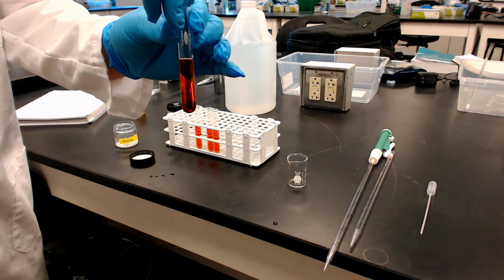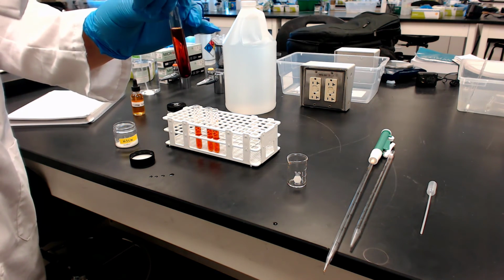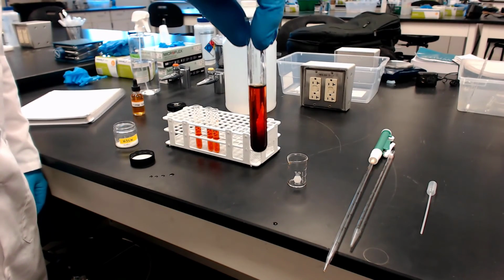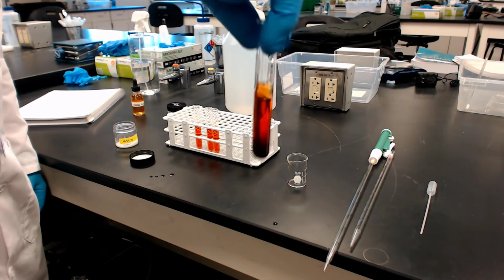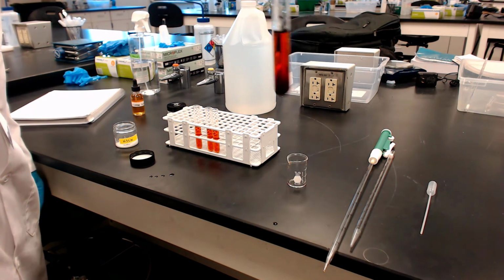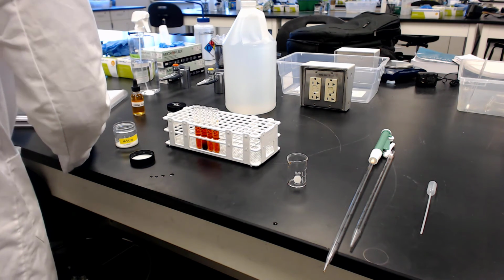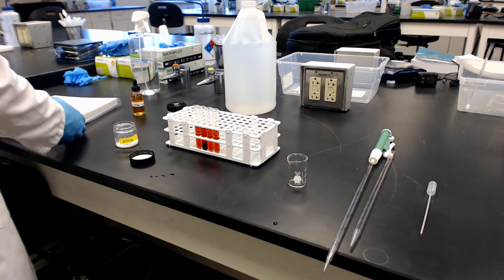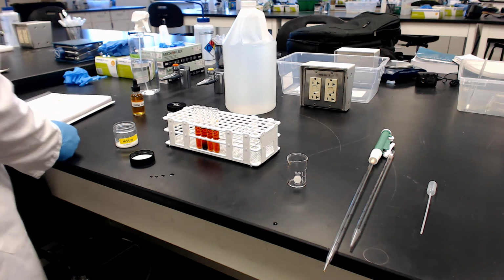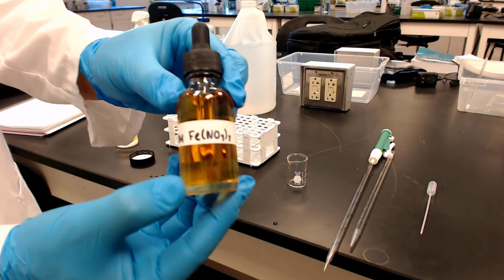So he adds that in there. It does a little swirling, and you can see it at the bottom. It's definitely driving the equilibrium. This is a good chance for him to use some technique he's probably not as familiar with: hold that tube firmly and just snap it with your finger on the bottom. But there you go. And again, that would have been a good picture, and you might want to wind it back and screen capture. That's the stress, and the response was how it acted.